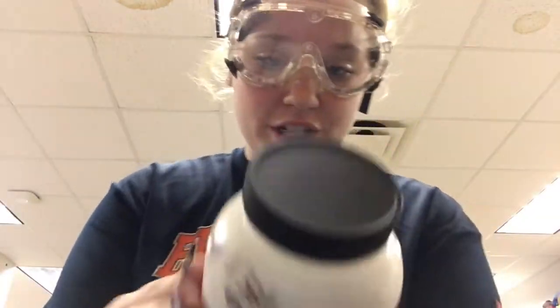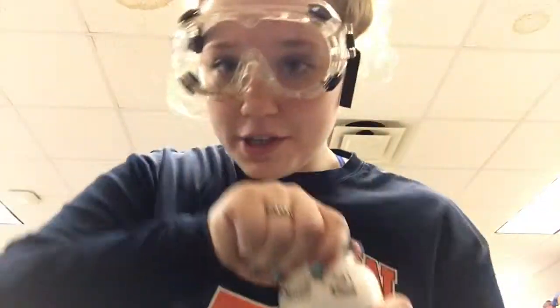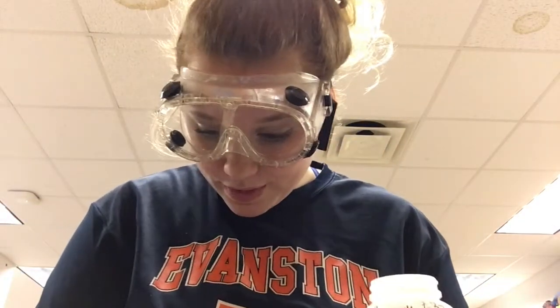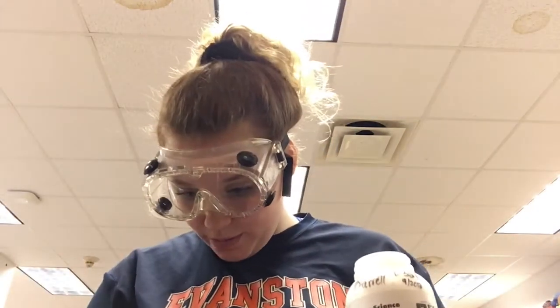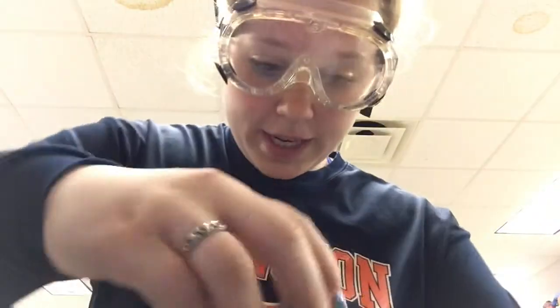Okay guys, so the first thing we're going to do is take this potassium chlorate that we mentioned before and weigh up 6 to 7 grams. So that's what I'm doing here with the scale and my weigh boat. Make sure you zero it. It's super important. All right, perfect. We have 6.27 grams of potassium chlorate, which will work perfectly.